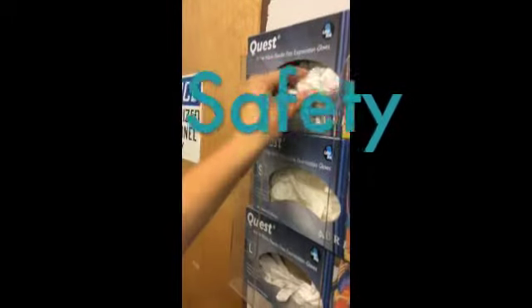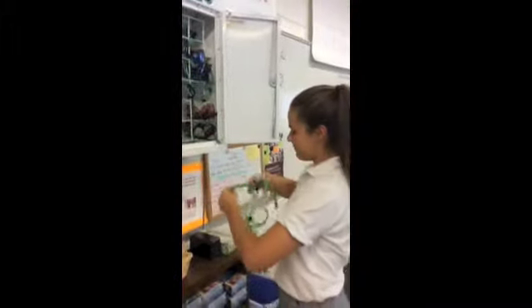Safety. First, gloves were worn at all times to protect hands from substances. Next, an apron was worn to protect clothes from substances. Then, safety goggles were worn to protect eyes from substances. Closed-toed shoes were worn to protect feet from any spilled substance.